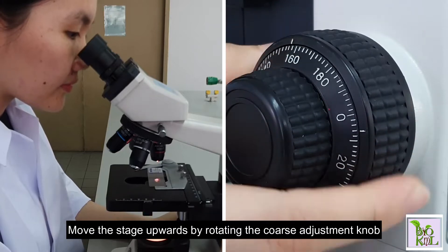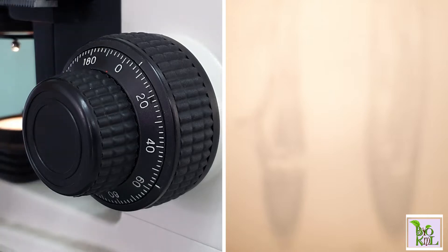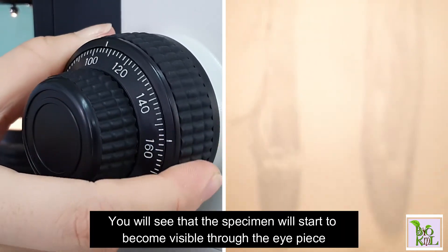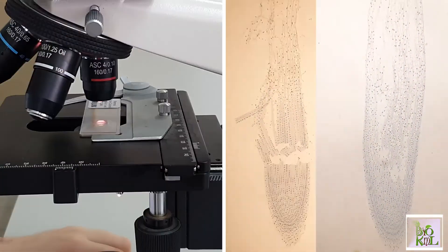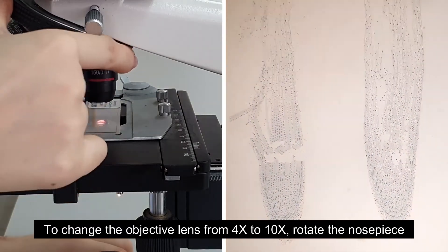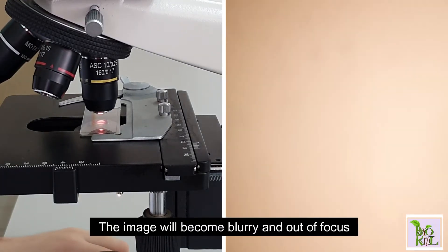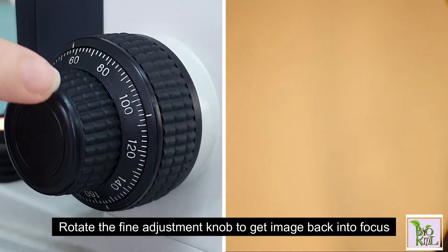Now move the stage upwards by rotating the coarse adjustment knob. As you rotate the coarse adjustment knob, you will see that the specimen will start to become visible through the eyepiece. To change the objective lens from four times to ten times, rotate the nosepiece.